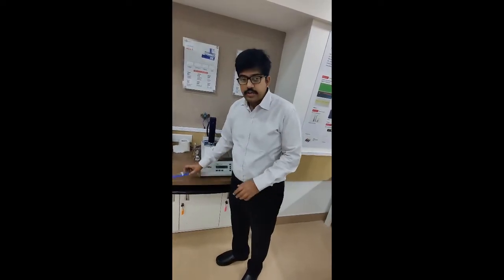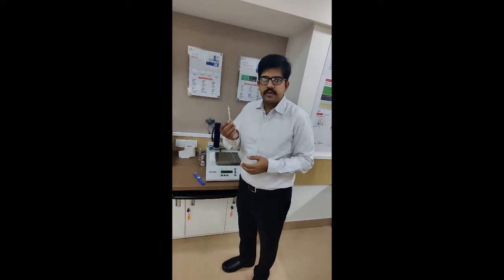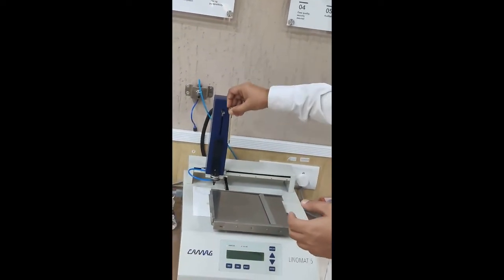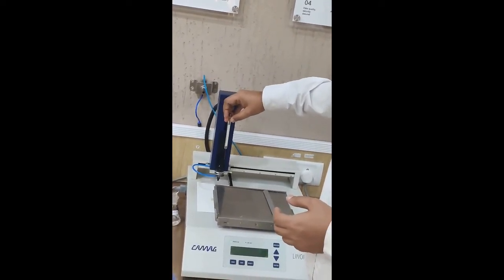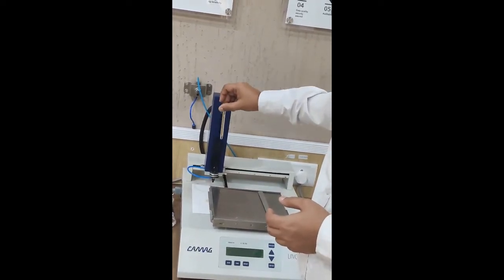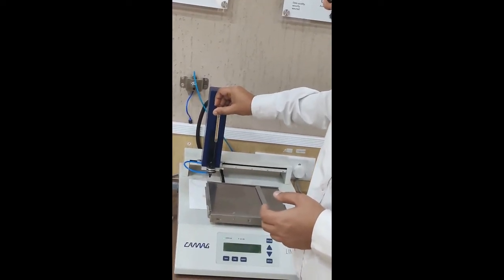If you face issues with the syringe when using the Camag Linomat 5, always use the syringe in the same direction. The syringe must be loaded into the turret in the same direction each time. If you first loaded it in a particular direction, continue your entire application by keeping it in that same position every time you load the sample.